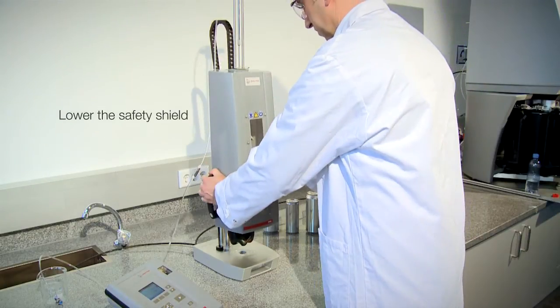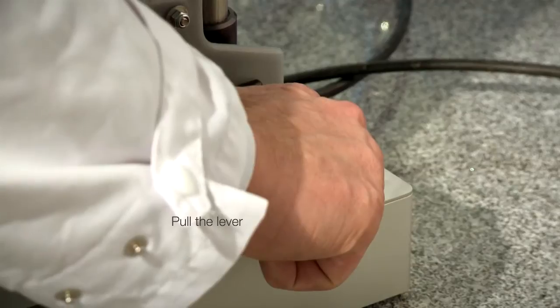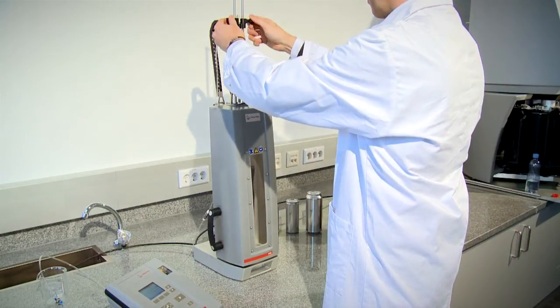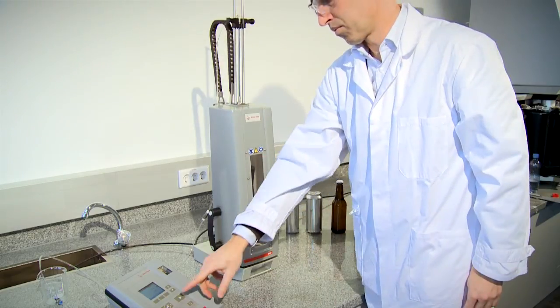Lower the safety shield, apply pressure, insert the sample tube, and start the measurement.